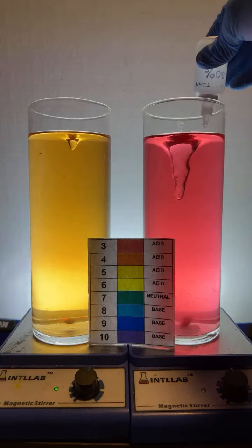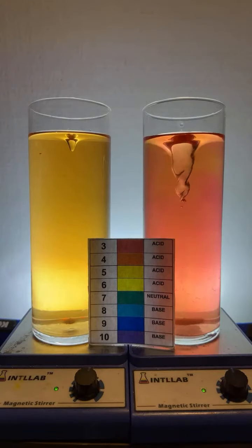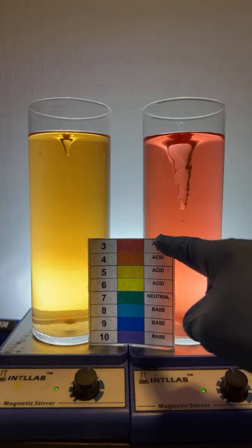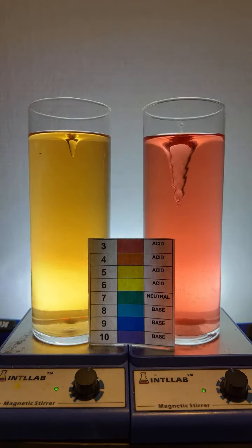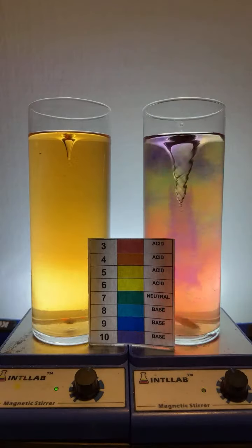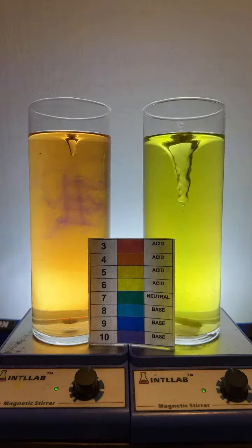Let's continue to add base over here. One drop. And yeah, again, the acid consumed the base, but you'll notice the pH went from 3 to 4. So, while the base was consumed, it increased the pH a little bit, making the acid a little more neutral. I'll add another drop over here. We'll add them a drop at a time. We'll do it over here on the left as well. So in goes your drop of base over there on the left.